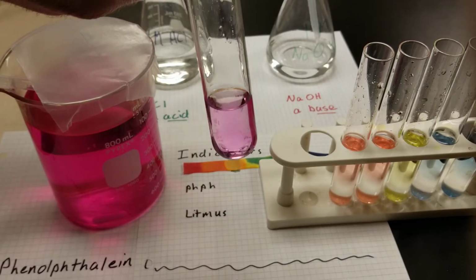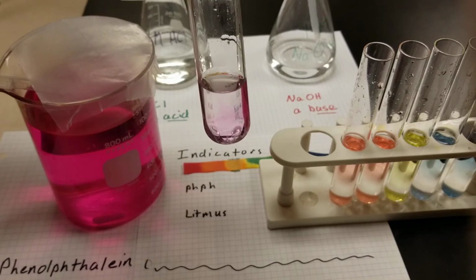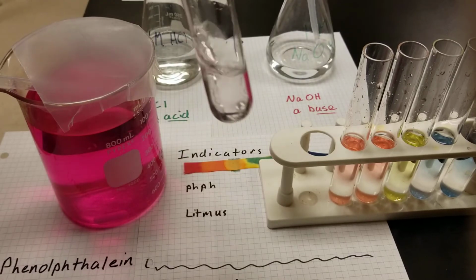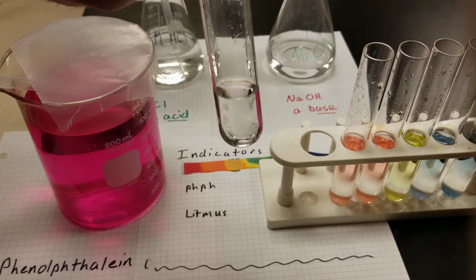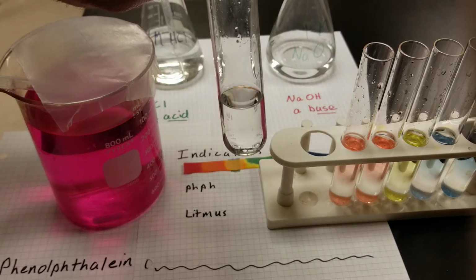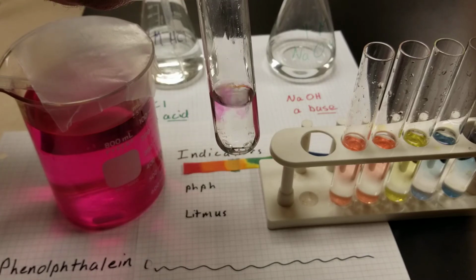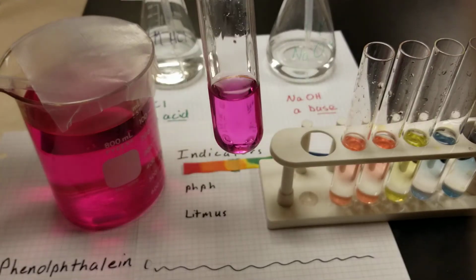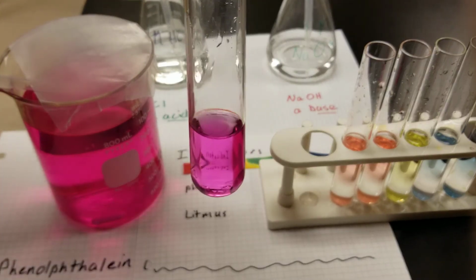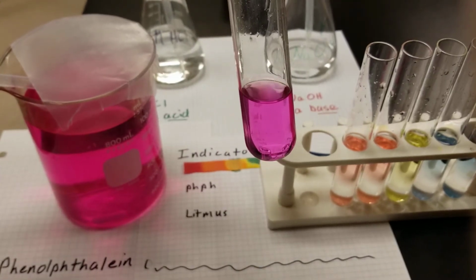A drop of acid. Looks like there's just about equal amounts of acid and base here, so we have just a tiny little bit of pink color. One drop of acid neutralizes any base that's left over, gives us a nice clear color. We do about 3 drops of base. Neutralizes any acid that's there, and then we've got an unbalanced amount of base, enough to allow this base to make our phenolphthalein pink.